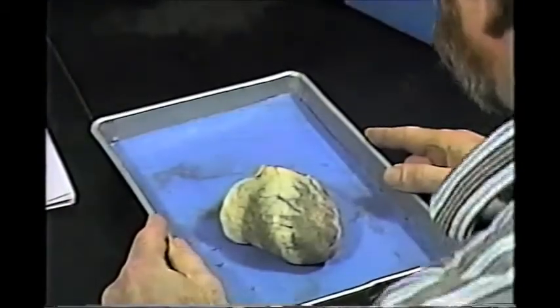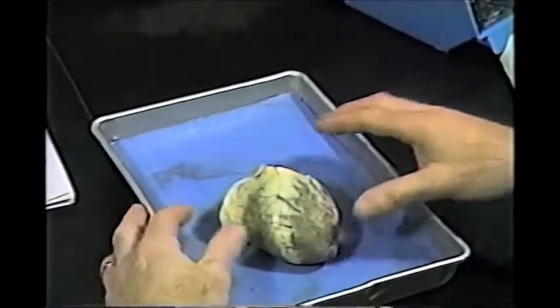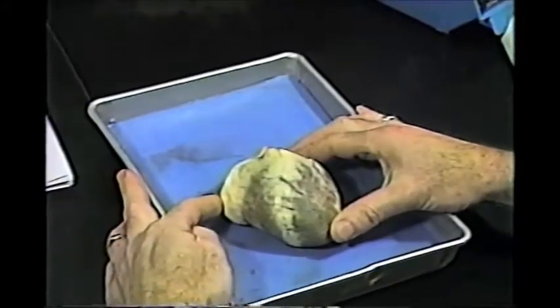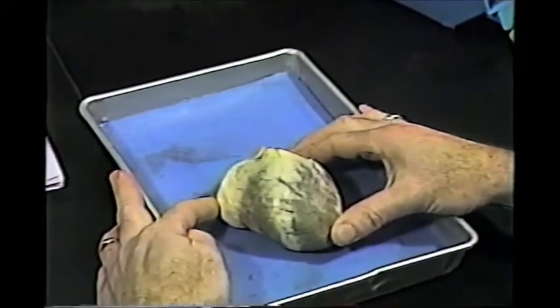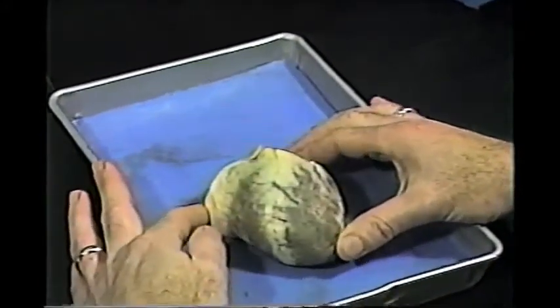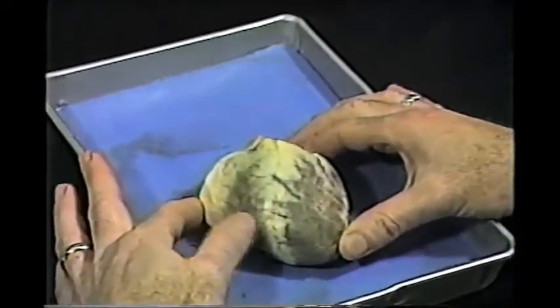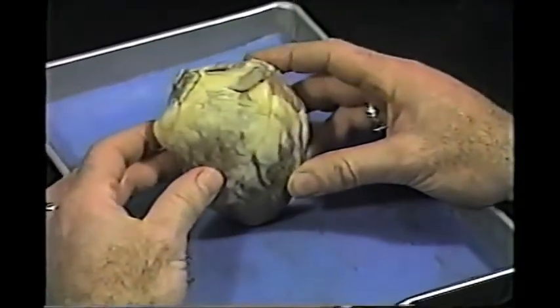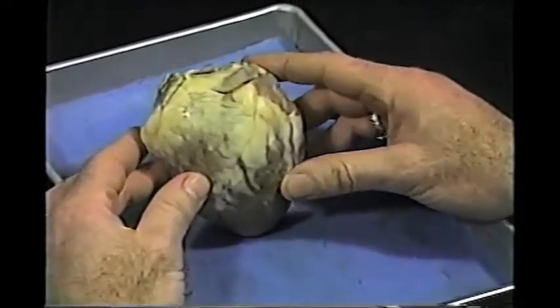Today we're going to do a demo dissection of a sheep heart, and that's what I have in the tray in front of me. This is a preserved sheep heart.